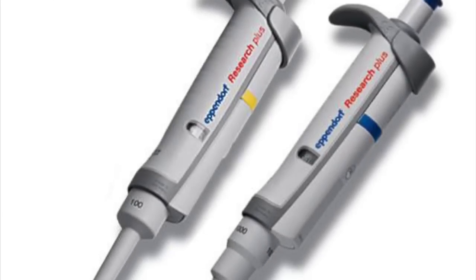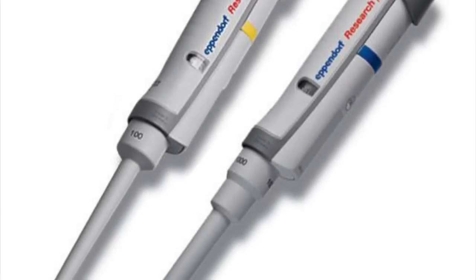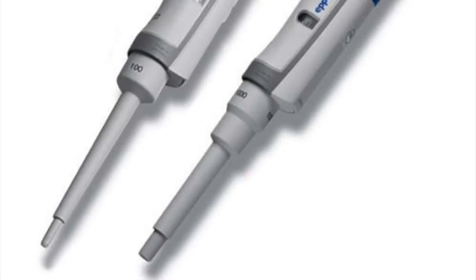A piece of equipment that is commonly used in a laboratory setting, particularly when dealing with bacteria, is micropipettes.